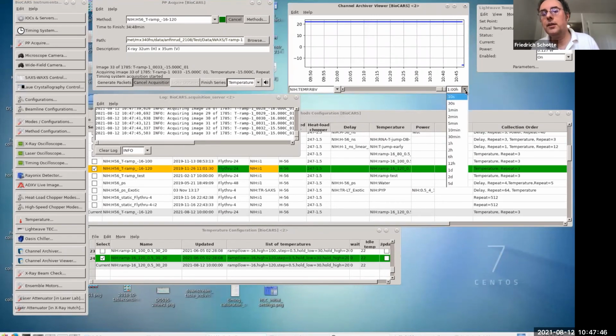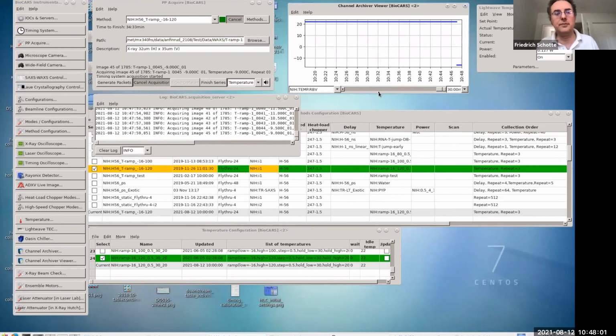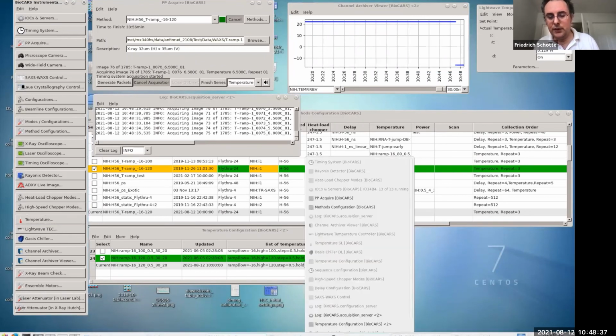If you zoom in a bit. Hmm. Let me start this over.